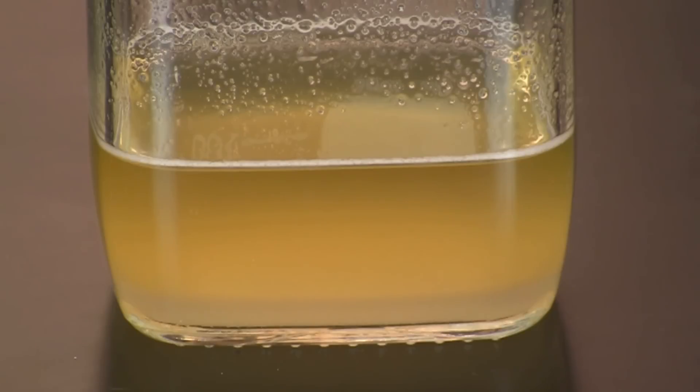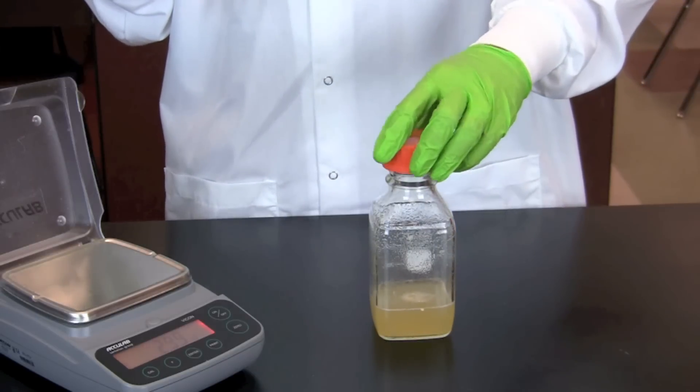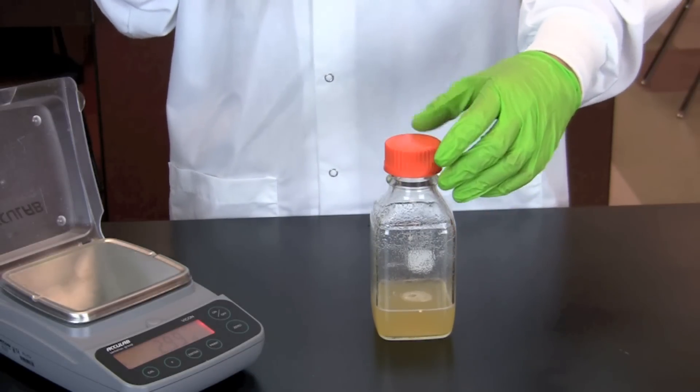Microwave the agar on a medium setting in 30-second increments for 1 to 2 minutes until it is clear. Make certain the cap is placed loosely on the bottle to allow steam to escape.